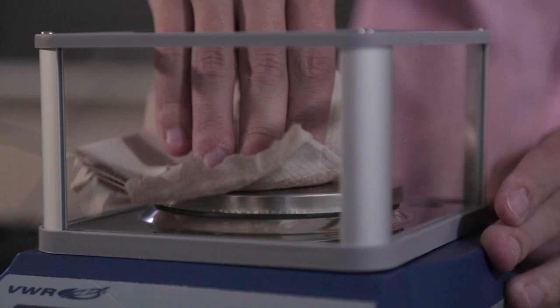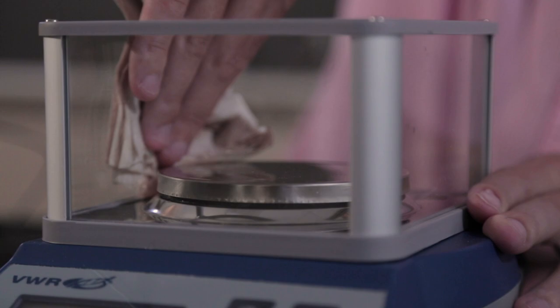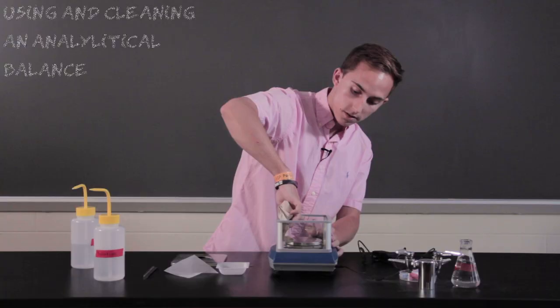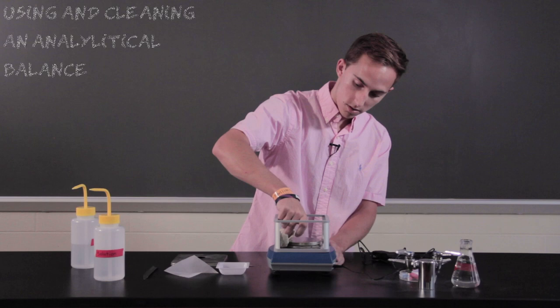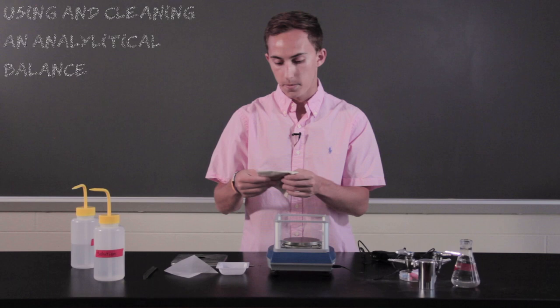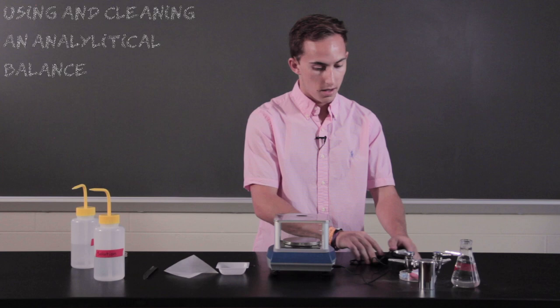and we're just going to go over and wipe it down. Trying to get any excess amount of powder and sample that is left over. You'll get the sides, and just to make sure it is all clean. And then you're able to put it back on the top, and you can store it as you normally would.